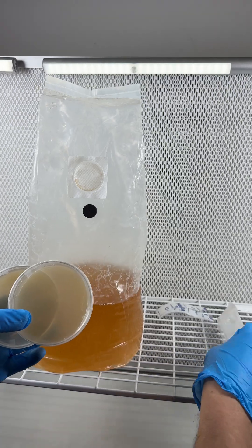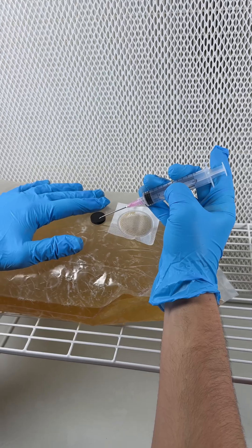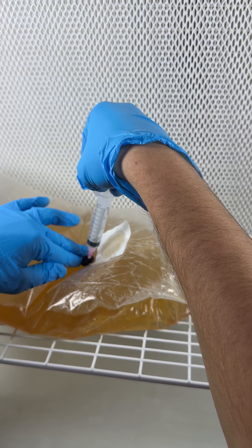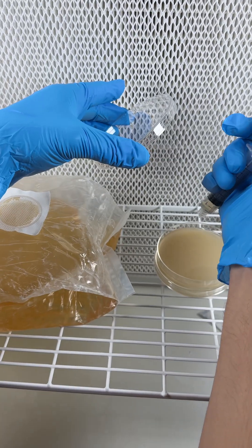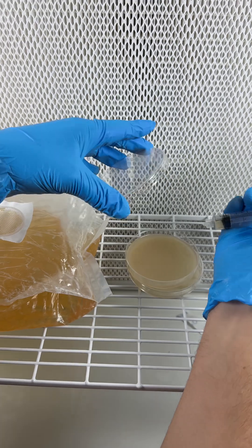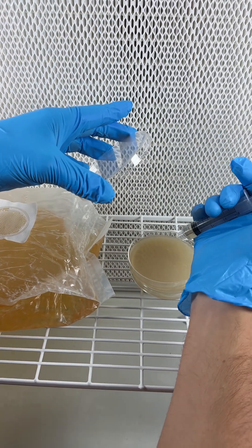It only took about one month for the mycelium to almost completely colonize the whole bag of liquid. At this point, I use a sterile syringe to extract a little bit of that liquid, and then I inoculate two agar plates to check to see if any contamination grows.